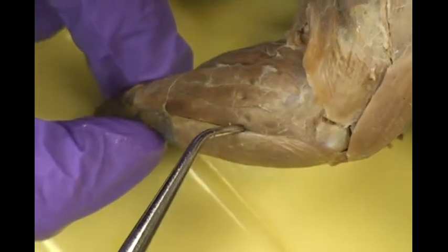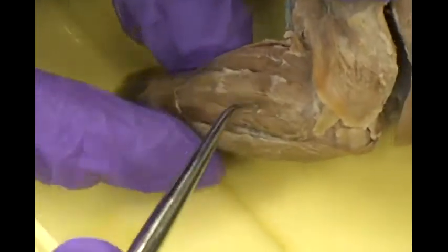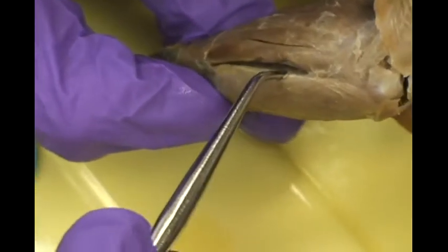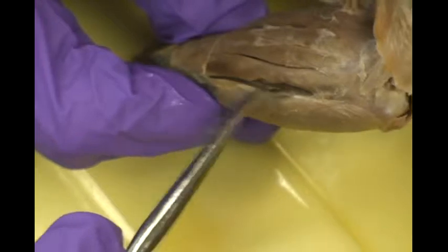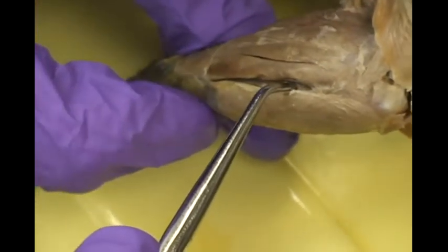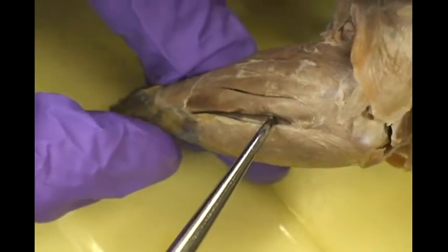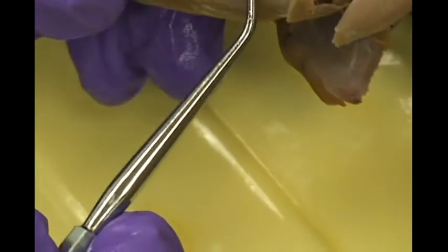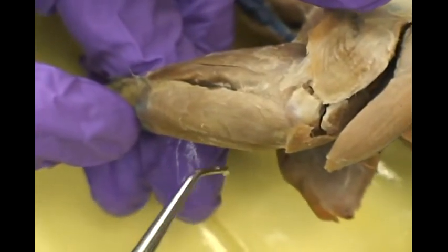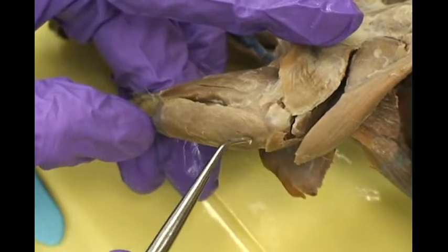Between these two muscle layers is another muscle — the flexor digitorum profundus. At the most caudal portion of the forelimb, you will see the flexor carpi ulnaris.